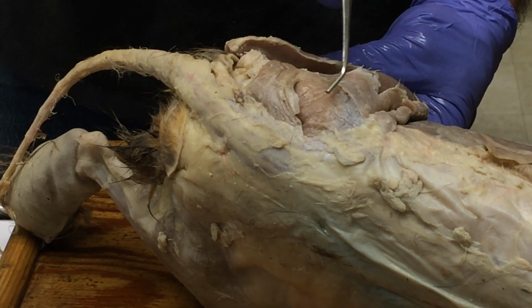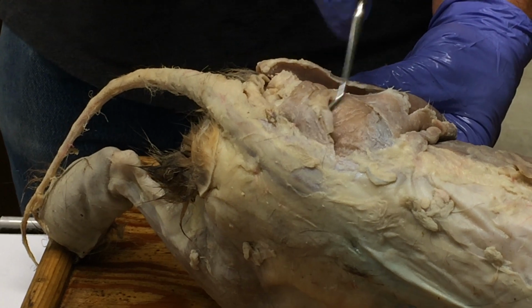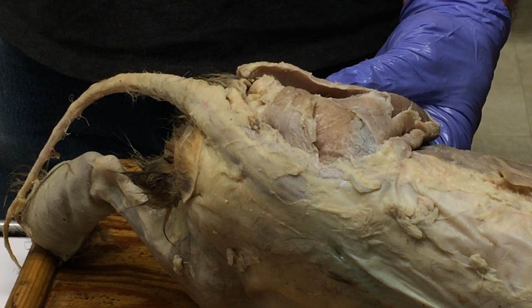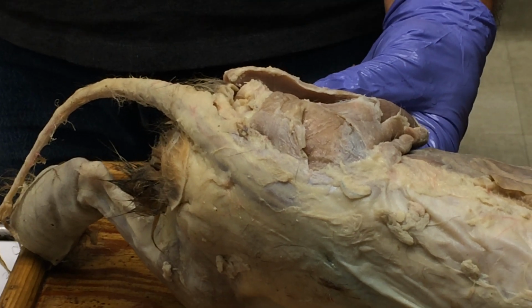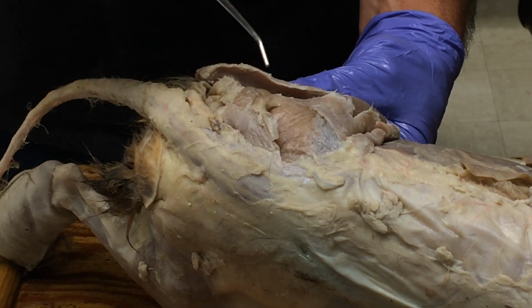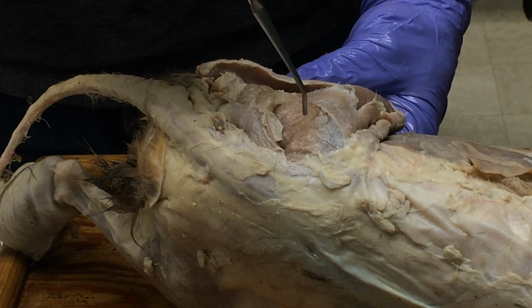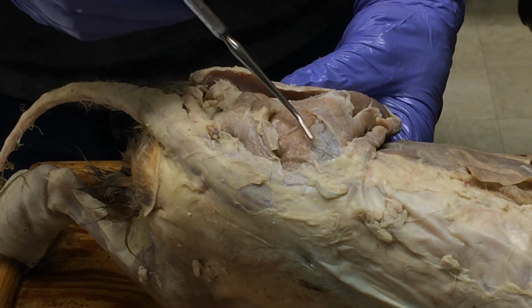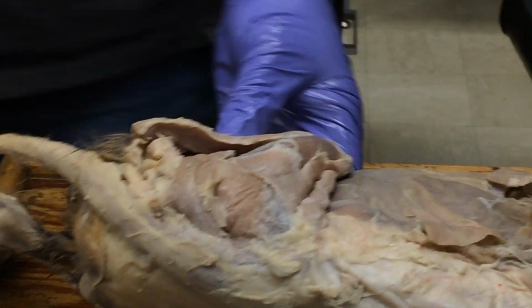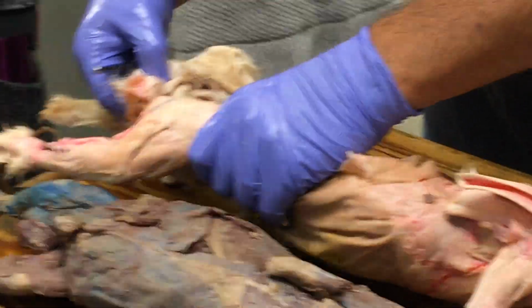And then lying more posteriorly or caudally, and also lying superficial to it, is this one here, and that's the gluteus superficialis, which is the same as gluteus maximus. Same thing, so either is fine. Okay, and then I don't believe we're in there yet, but if you cut deep through gluteus medius, you would see gluteus profundus or gluteus minimus lying deep to it. Okay. I'm not sure if any of you guys got there, but it's okay. I'll forgive you.